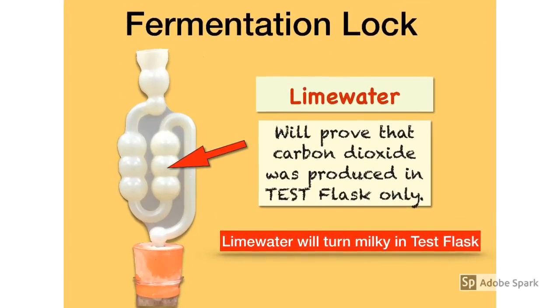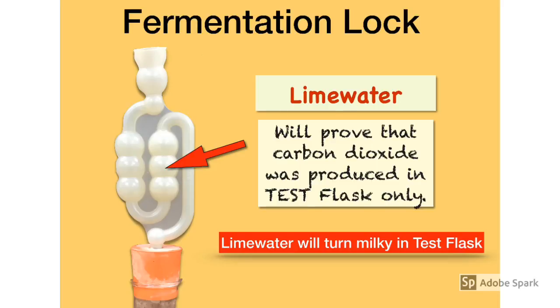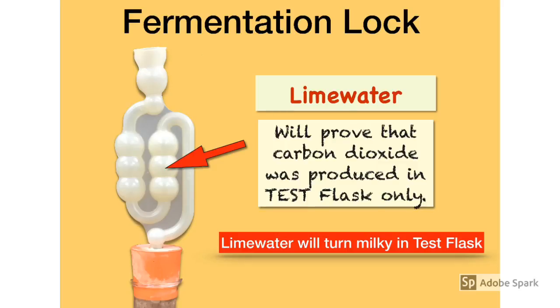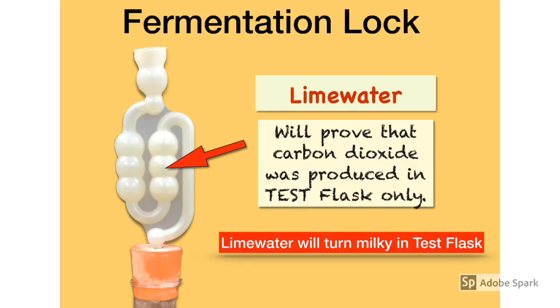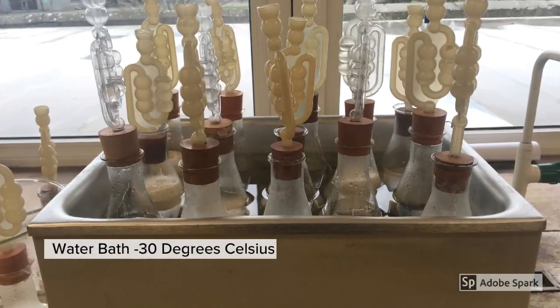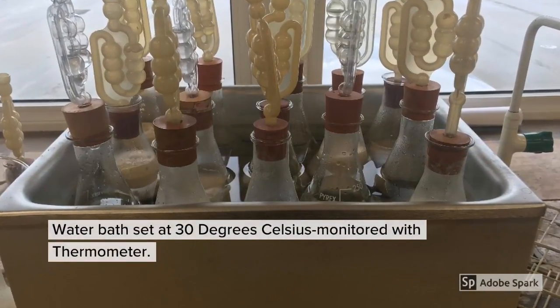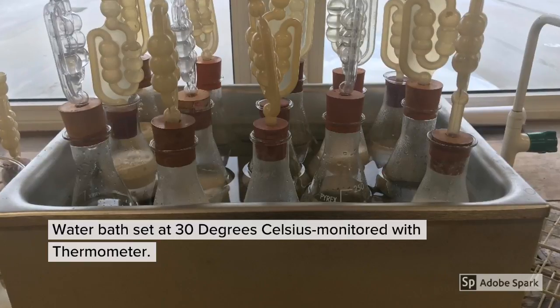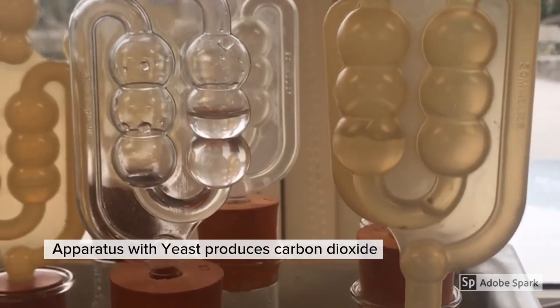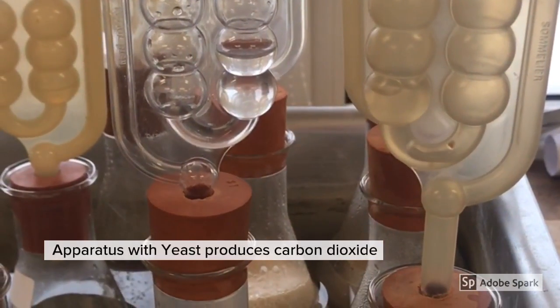We also added lime water to our fermentation lock, which was useful in proving that carbon dioxide was being produced in the test flask only. The yeast cells anaerobically respiring give off CO2, which bubbles through the lime water and turns it milky. When the test and control flasks were ready we placed them in a water bath set at 30 degrees Celsius. The temperature was monitored using a thermometer and the water bath was left for 24 hours. After a few minutes it was evident that bubbles of CO2 were visible in the test flask but none in the control.